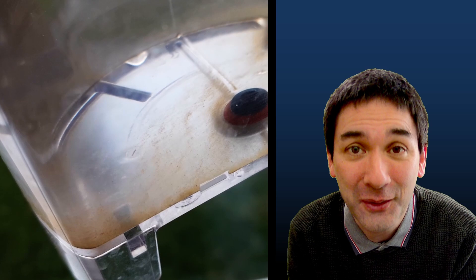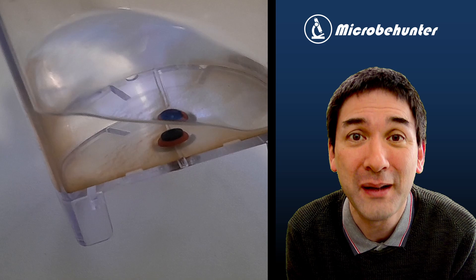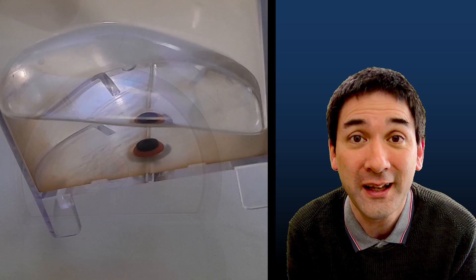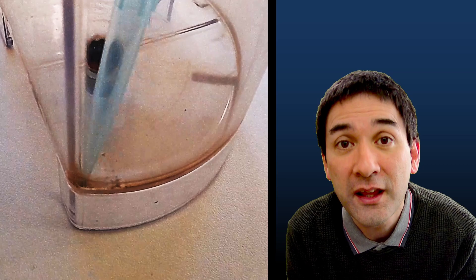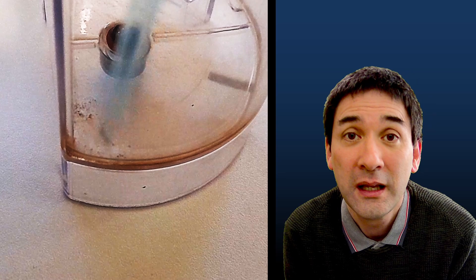Yes, today a little bit of microbe hunting in my kitchen, because where there is water, there is life. And in the water tank of my coffee machine, I found this brownish-greenish layer, and I immediately realized this must be a biofilm. So biofilms are thin layers of microorganisms, algae, maybe also some protozoa growing there, bacteria, of course.